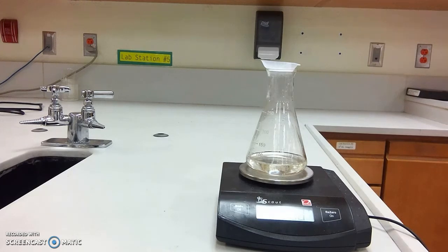And again, what we're looking at here is that if our sodium bicarbonate has gone through this reaction and produced carbon dioxide, those bubbles were carbon dioxide gas. And now that carbon dioxide gas should be in the air. That's the assumption that we're making. That carbon dioxide gas is now in the air, not part of our system, and not being measured in the mass right now. So by calculating the difference between the starting mass and the ending mass of the entire system, we should get an exact measurement of how much carbon dioxide was produced in this reaction.